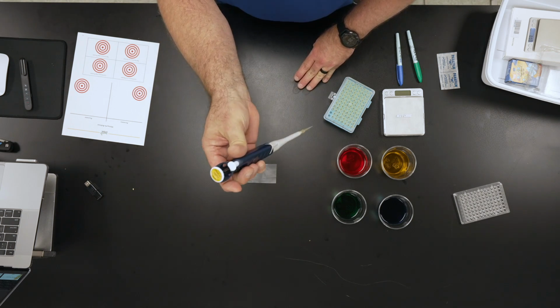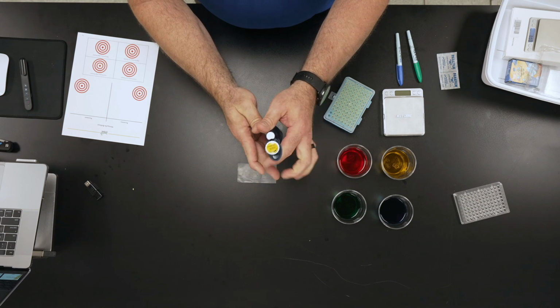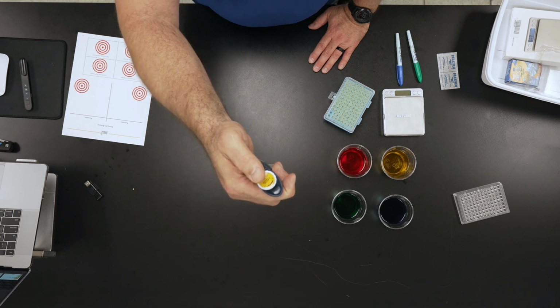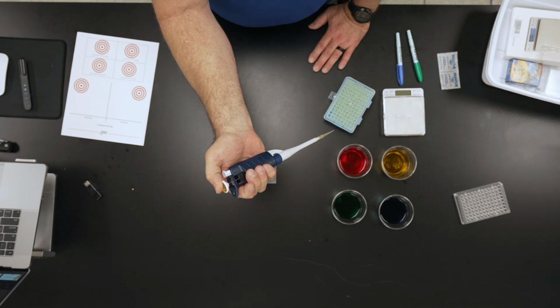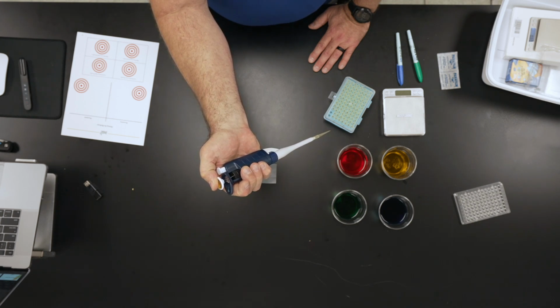Now this is actually designed to be held with either hand. I can do it with either hand. But as I'm holding this with my right hand, my thumb will be able to push down on the plunger. And the plunger is right here. I can push the plunger down, and when I push it down, there's a stop there. That's the first stop, and we call that the soft stop. The hard stop is if I push it further down, a little bit further beyond that.